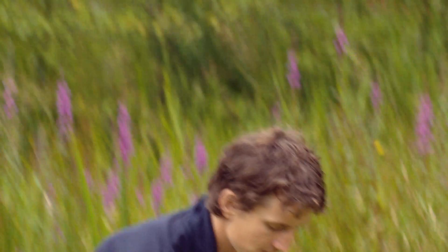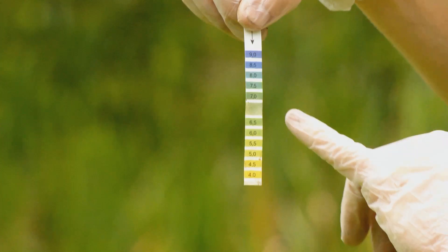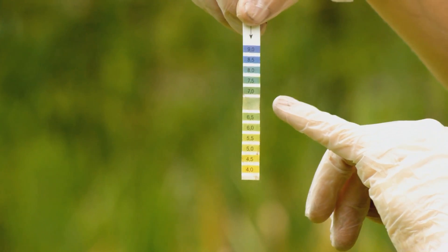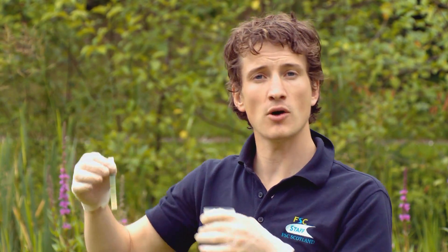I also have a pre-prepared test strip here. The colour is a slightly light green, which indicates a pH value of about 6 — that's in the optimum range, meaning plants and animals should be able to survive here just nicely. Soil pH is really important information for many different people, including farmers and gardeners who want to grow plants, but also for scientists interested in the biodiversity value of the area and the things living on top of or underneath the soil.